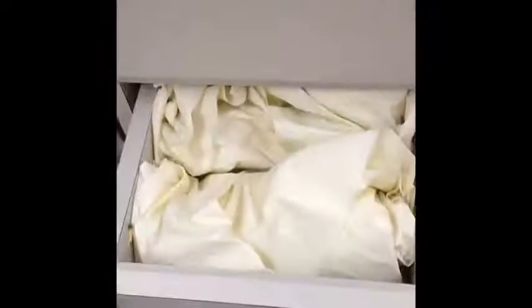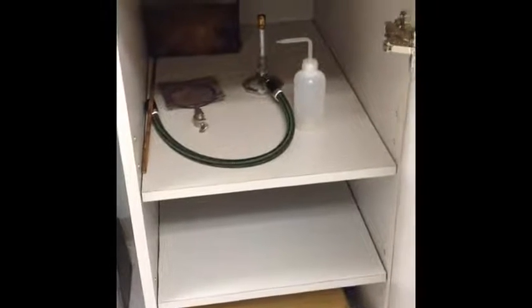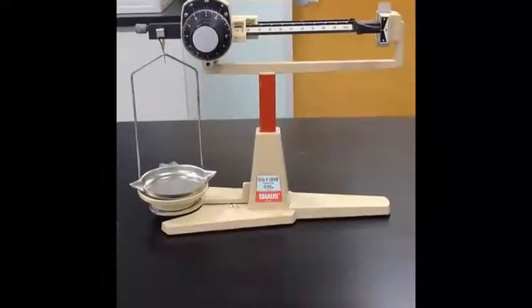You will find in the drawer that's numbered for your lab station, the top drawer has equipment in it, and there will be an inventory sheet that will list the equipment that you should find in that drawer. The second drawer has lab coats, which should be returned neatly to that lab station, and the cupboard next to it, which has the same number, has some additional pieces of equipment, which will include a Bunsen burner, ring stand, iron ring, wire gauze, and a wash bottle.